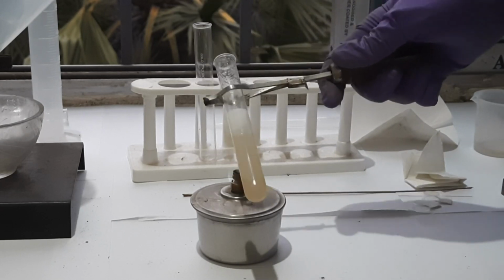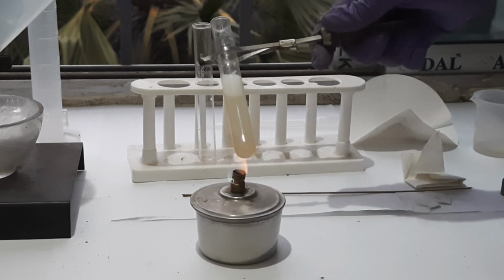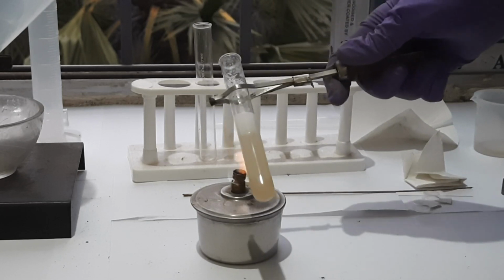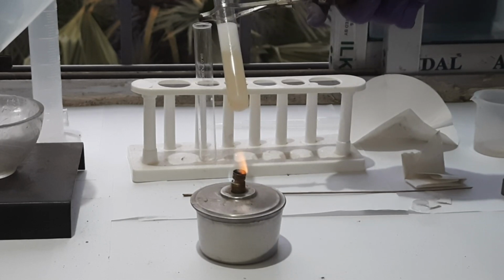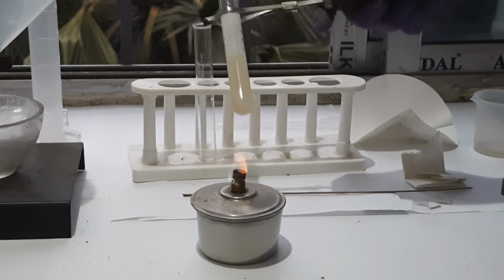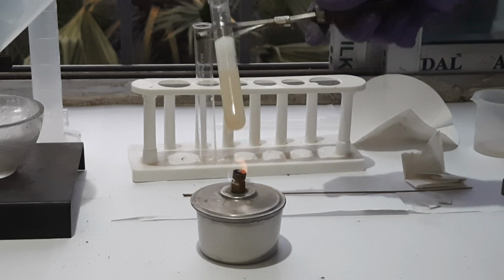Otherwise, hot liquid can come to your face. As you are using a spirit lamp, you can see no black spot or carbon layer is produced, as it is complete burning. But in other videos I used a candle, so some carbon was accumulated.